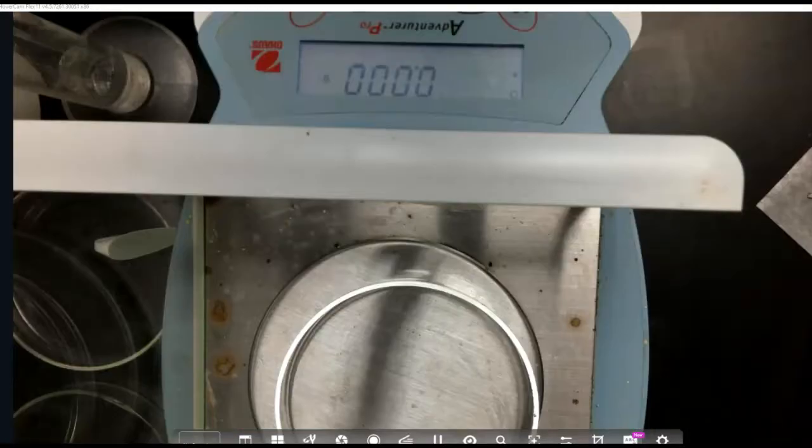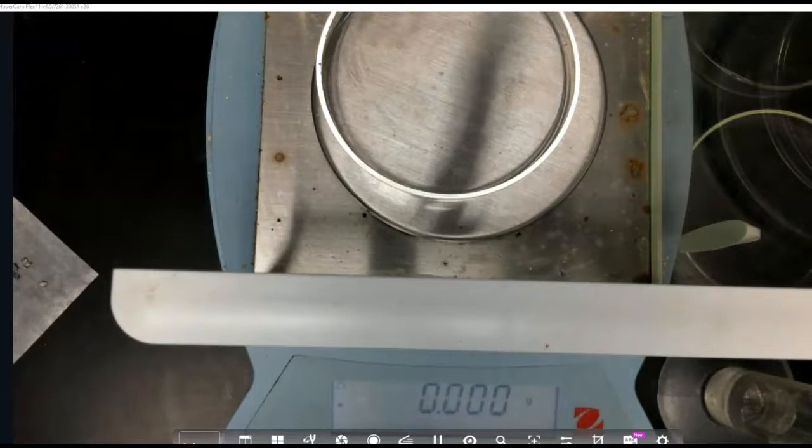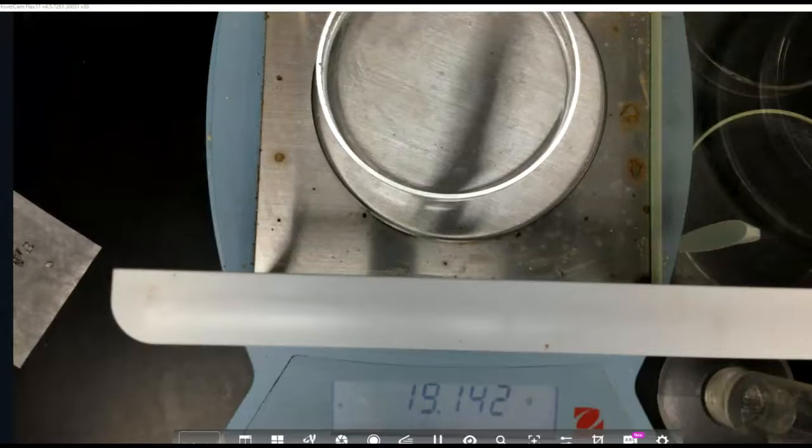Okay, our last reaction was with 0.070 grams of magnesium and with 20 milliliters of 1 molar hydrochloric acid. We are still going to use 20 milliliters of 1 molar hydrochloric acid, and that is what I just put in the petri dish. But now we are going to add to that the 0.070 grams of shredded up pieces of magnesium instead of a ribbon of magnesium.